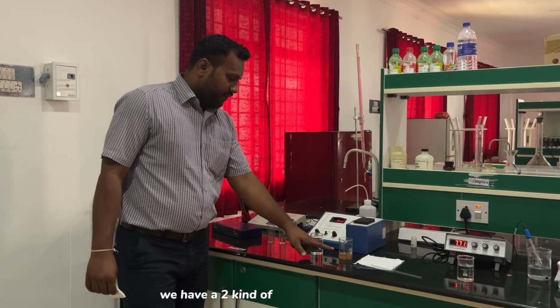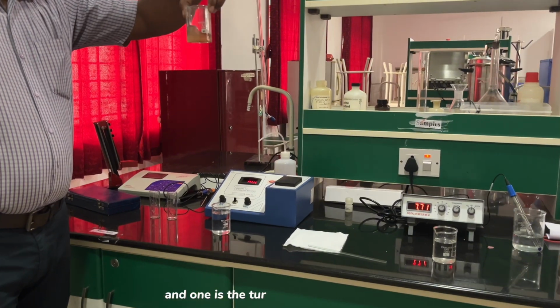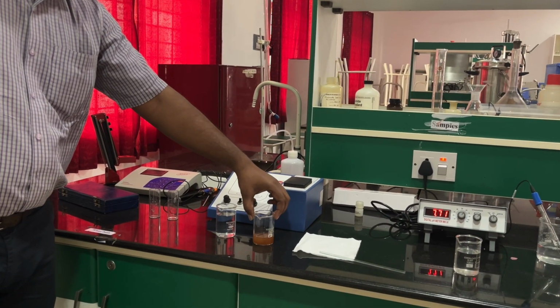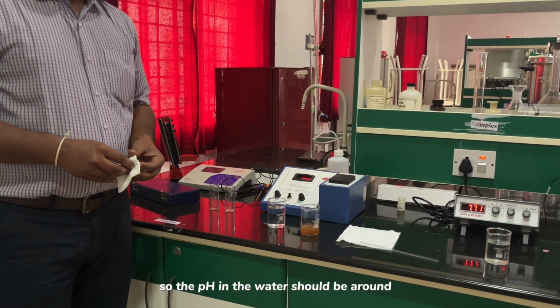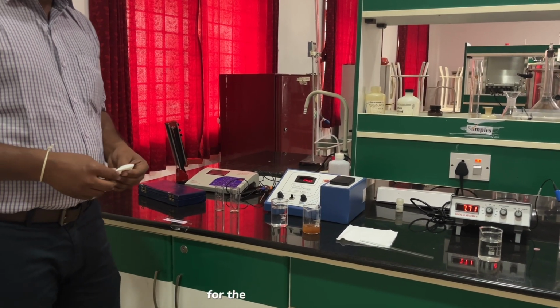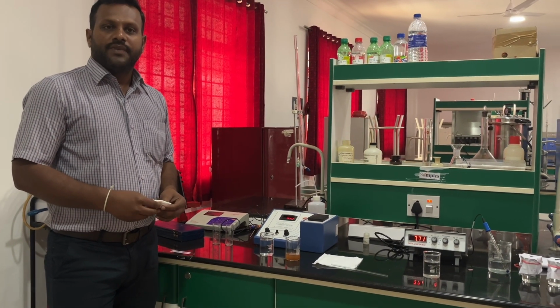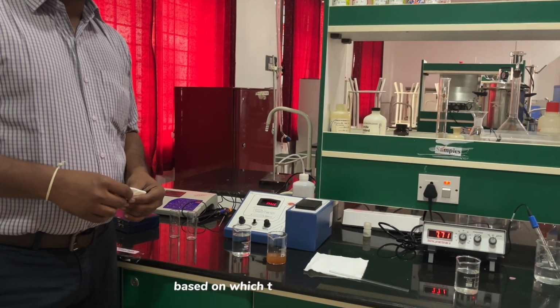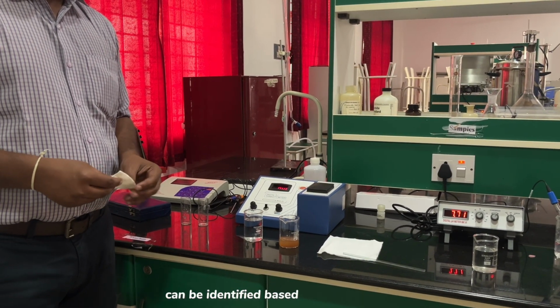We have two kinds of samples with us. One is a blank sample, and one is the turbidity sample. In the last case we have seen the pH. The pH of water should be around 6.5 to 8.5 for drinking purposes, as per the 10,500 code. You can check your pH, based on which the water can be identified as acceptable for drinking or not, based on the code.